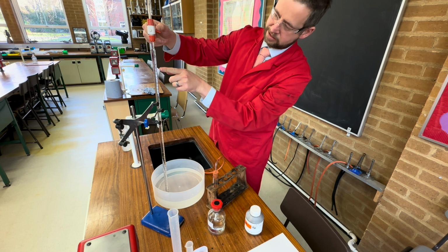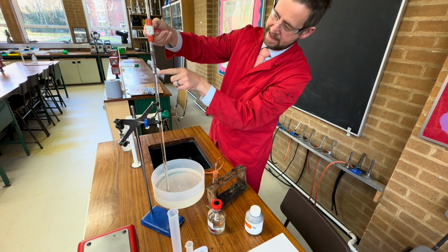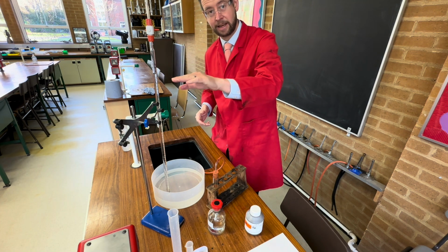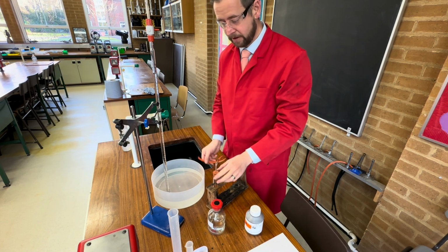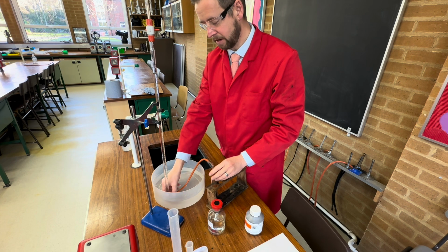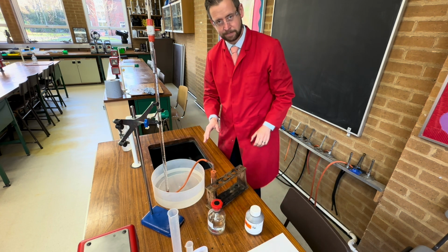We need to now let some air in until the point where the air is on the scale. It doesn't matter where, but we need to be able to take an initial reading, and we can't do that if it's full all the way to the top. The delivery tube can very carefully be placed underneath, making sure that it's well in, and then what we can do, we get ready to mix our chemicals.